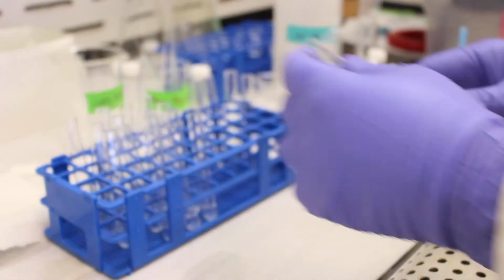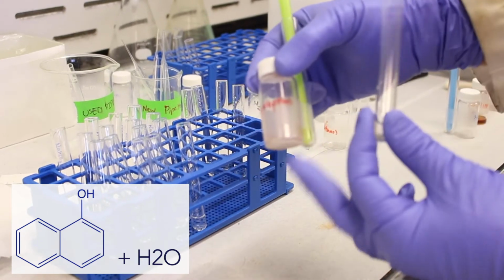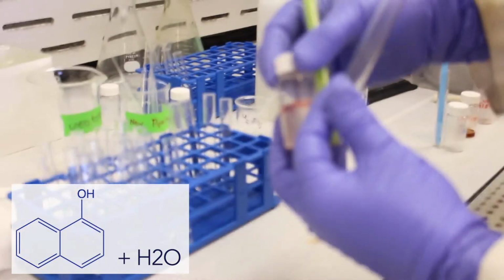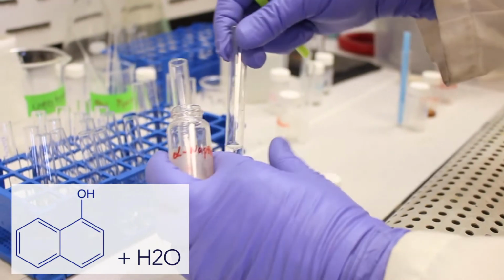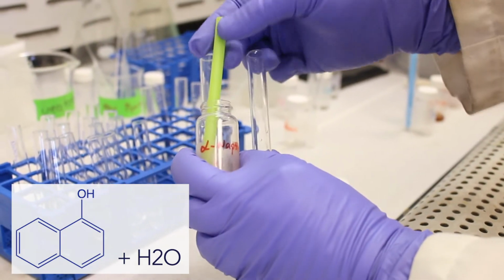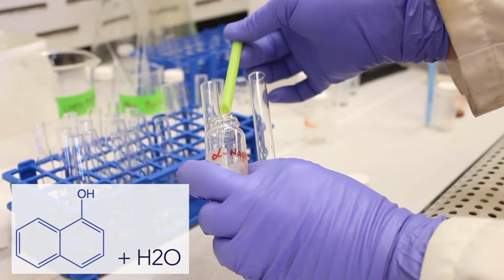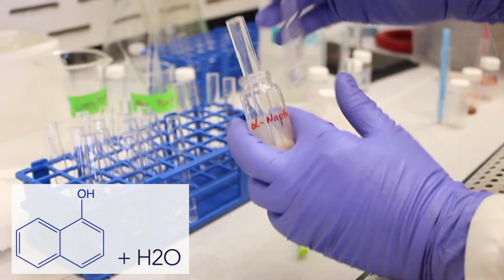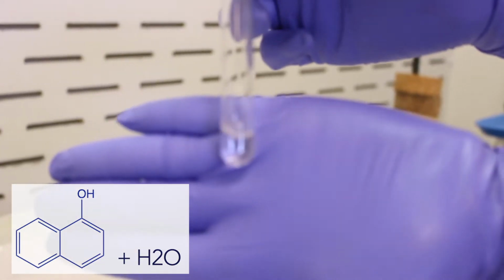Just to be certain, we'll start with our control again with water. And this, by the way, is the alpha naphthol. It's a solid brown powder. So we'll open the vial here. We'll take a few crystals or a few bits of solid and we'll place them into the test tube. There's a little straw here. Okay, and as you can see, maybe I'll put my hand behind it.